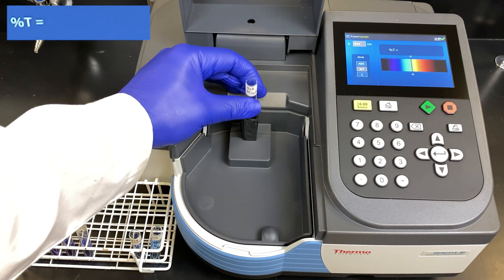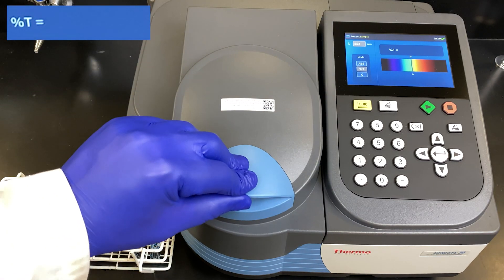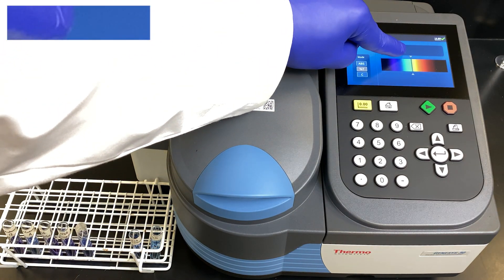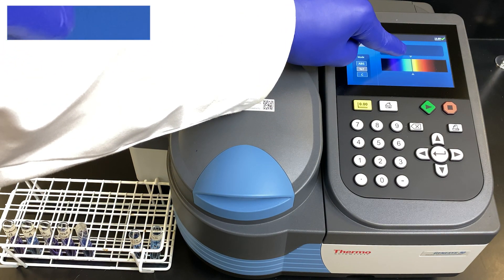Placing it into the machine, closing the door, waiting for it to stabilize, and recording this into our laboratory notebook.